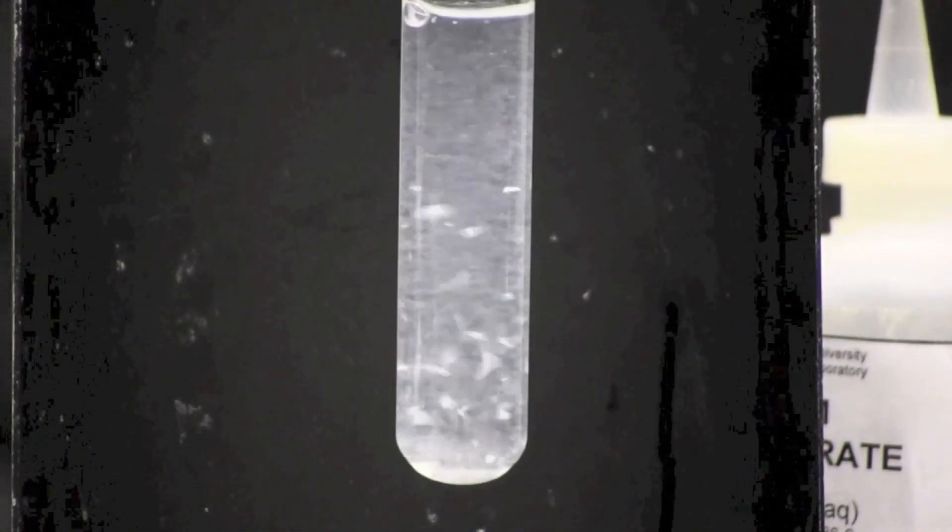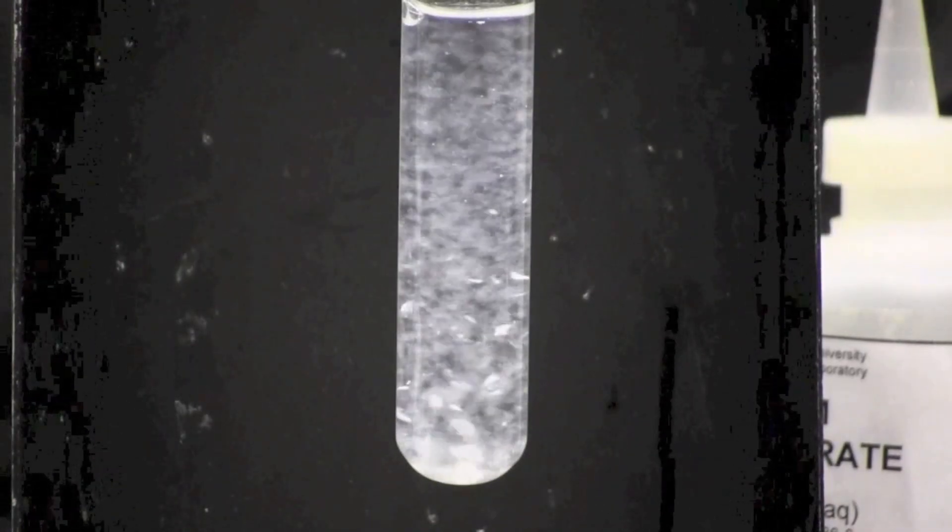I'm going to mix this together a little bit here, and you can see the white precipitate starting to form.